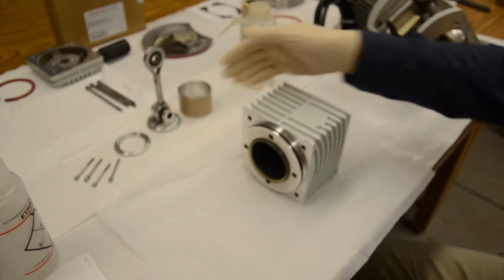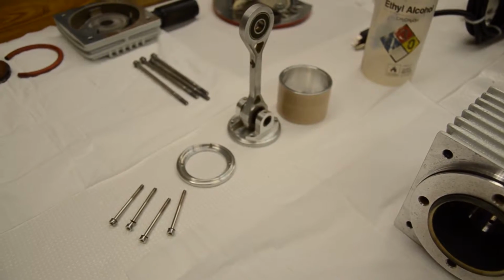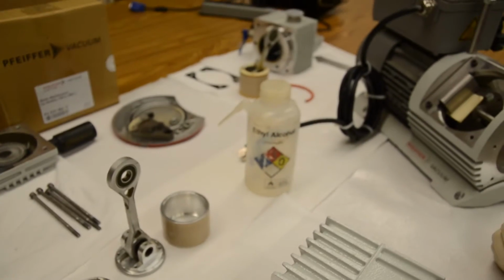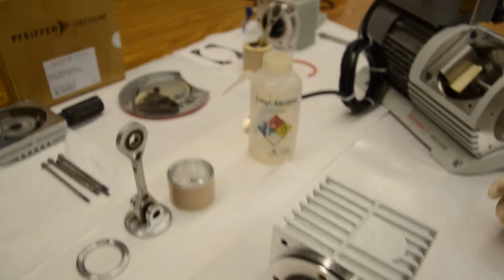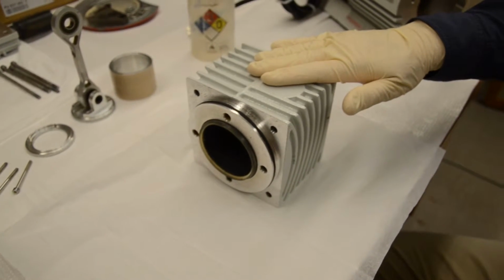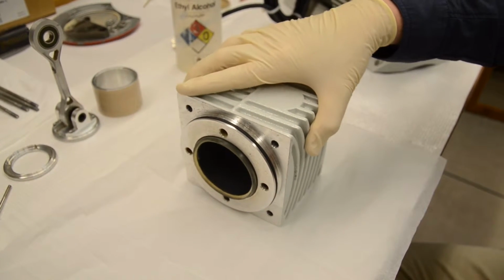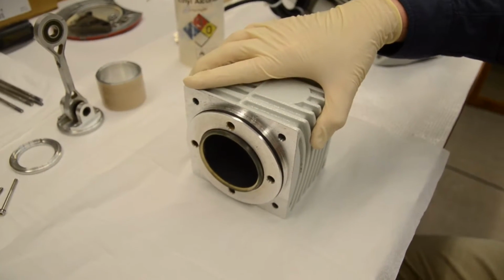As you can see, this right here is the cleaned assembly for the left side. The right will go apart and get cleaned in the exact same manner, so there's really no reason for us to show it. So the next thing we're going to do is move right here to the high pressure block. Actually, sorry, this is the low pressure block. Is that right?